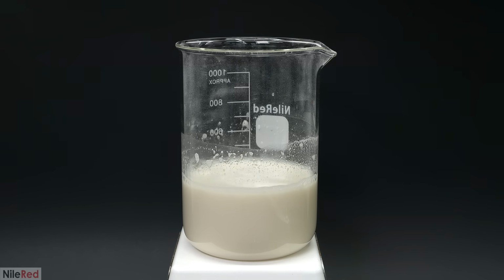They don't get attacked by the cellulase, and the yeast, in the fermentation step that I'll be doing later, aren't able to break them down either. I even confirmed this by doing a separate control run, but I'll talk about that later in the video. Because these fillers were inert, I could have just directly used this mixture as it was, but I wanted to clean it up a bit and to get rid of the cornstarch.